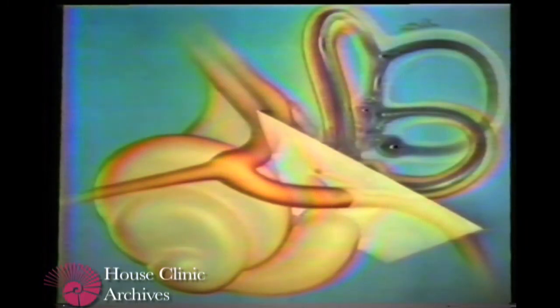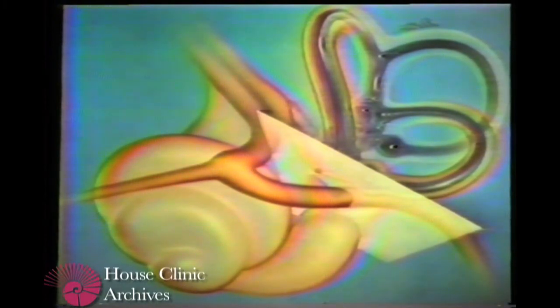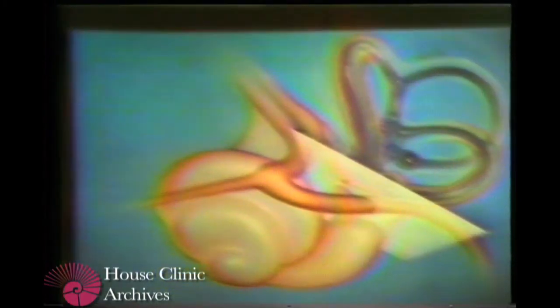Of interest here is a very small fracture line running between the ampulla of the posterior canal and the round window niche. This has recently been described elsewhere, but the other author and ourselves have found it is constant. It is filled with fibrous tissue and may not represent a fracture, but some anatomical variant, the purpose of which remains obscure. The next section will illustrate a vertical cut through the area of the vestibule and oval window.